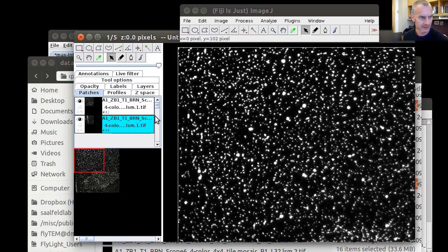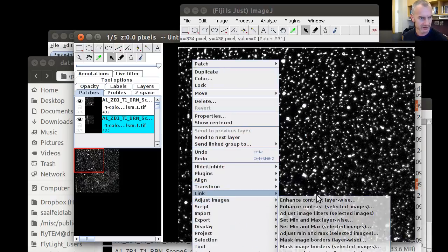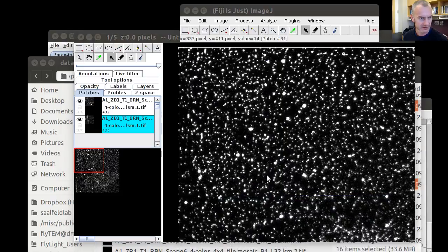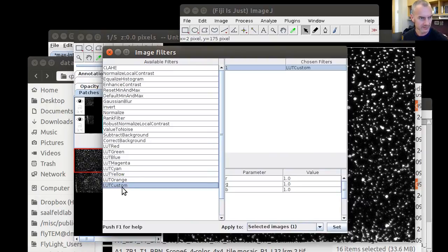Then we click an arbitrary tile and we adjust the images. Let me pop up this dialog here. So we adjust the image filters, which opens this little window. And first thing we do is we use a custom lookup table with the color white instead of the arbitrary colors that the export of the TIFF files has generated.